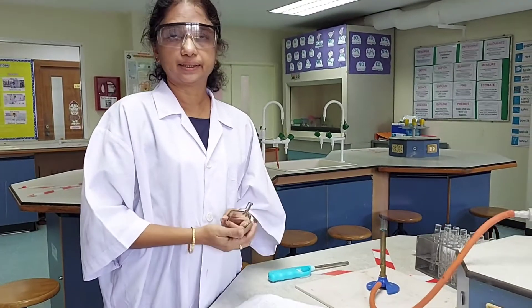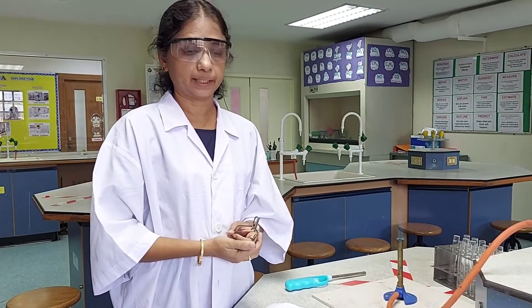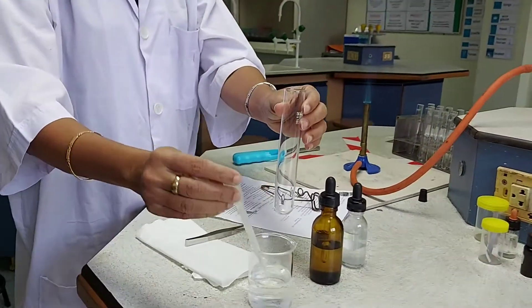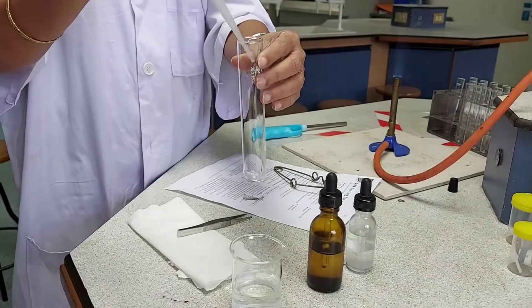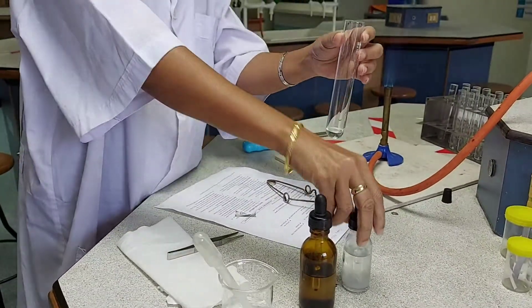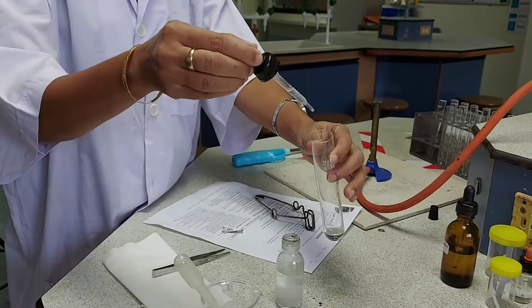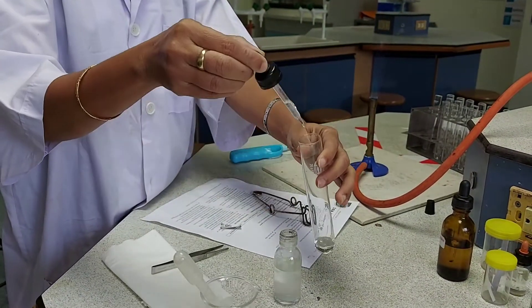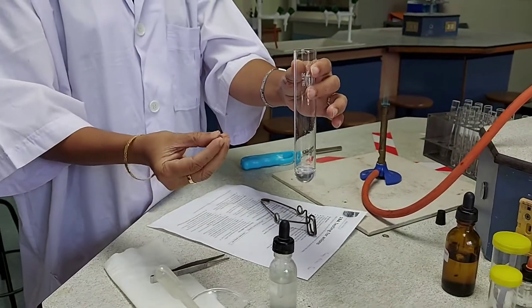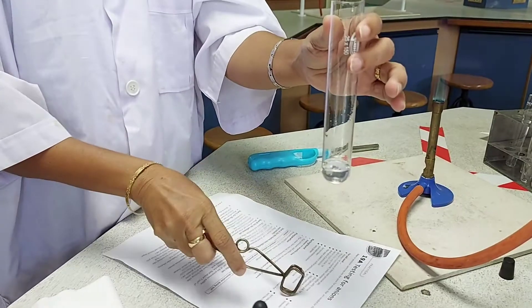The next given solution contains nitrate ions, and we have to identify their presence by carrying out the following test. I take a boiling tube into which I add a few centimetre cubes of the given solution which contains nitrate ions. To this I am adding a few centimetre cubes of sodium hydroxide, and then I put a piece of aluminum foil into the solution mixture and gently heat the mixture.